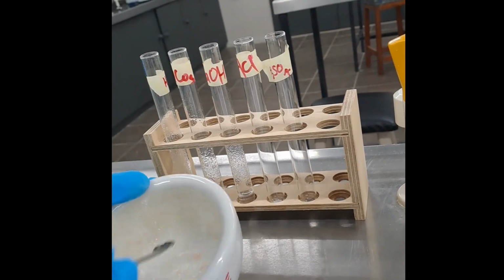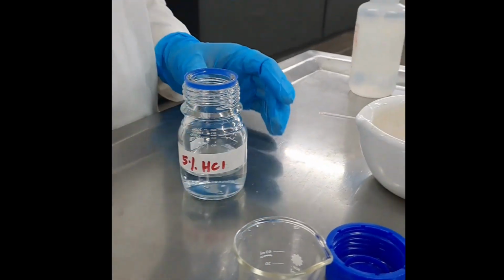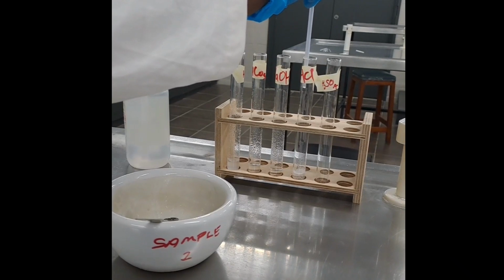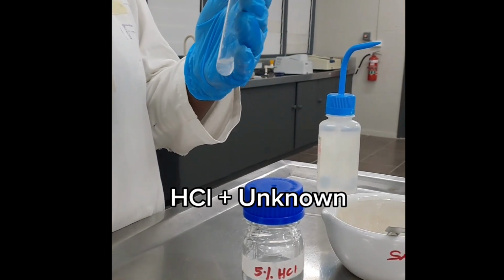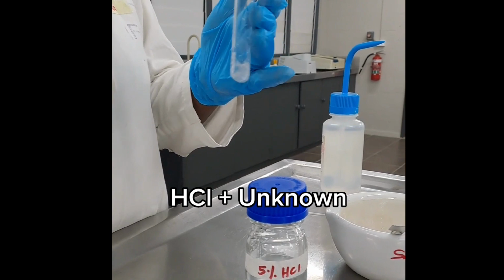Moving on to the next reagent, take a small quantity of the unknown substance and add it to the test tube labeled HCl. Add a few drops of HCl into the test tube. Shake the test tube properly and observe carefully. It was concluded that the unknown substance was soluble in HCl.